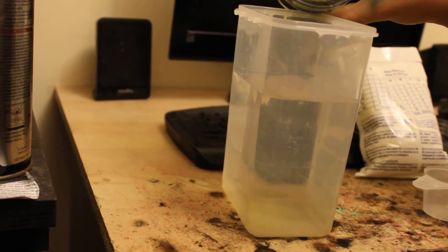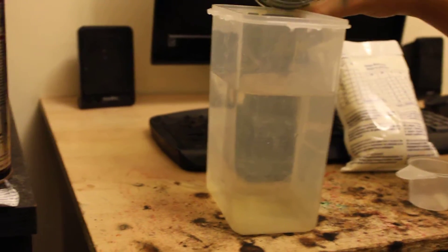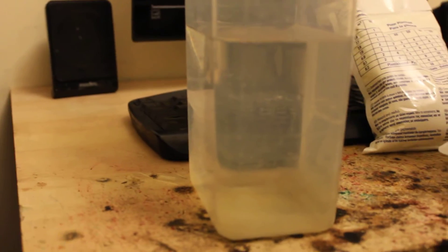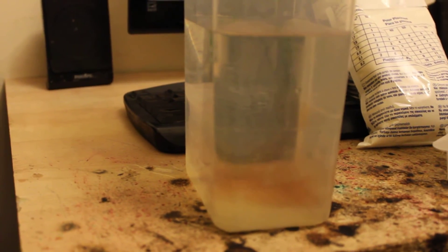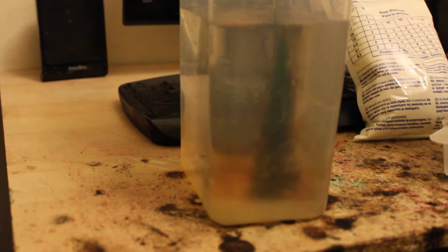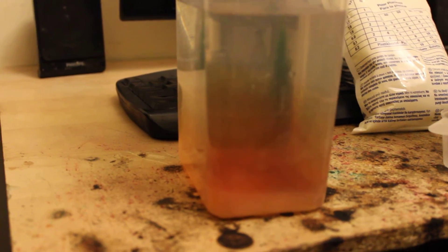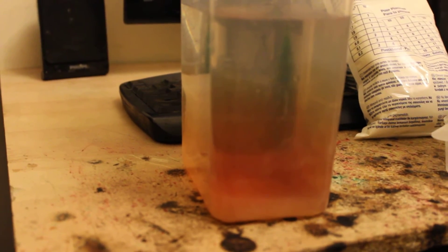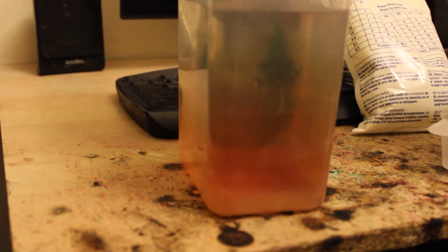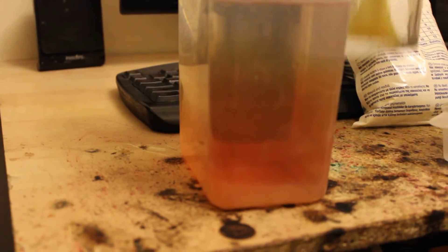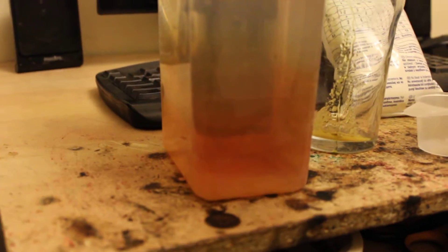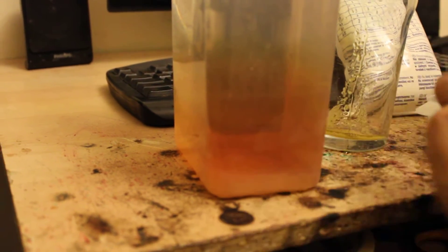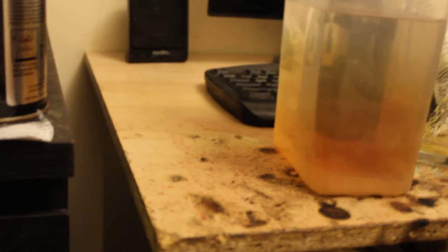The more acid you add, the more sensitive, but if you add too much acid, you'll end up destroying the dye. You can see the moment the solution hits the water it changes from blue to red. You can see that there's just from that tiny amount, like three granules of this in this entire container, the whole thing just turned.